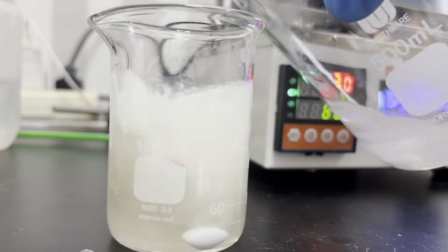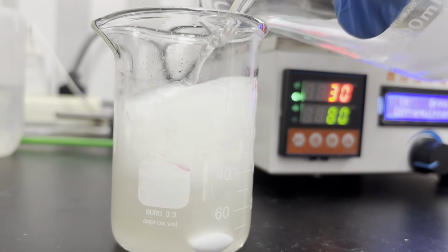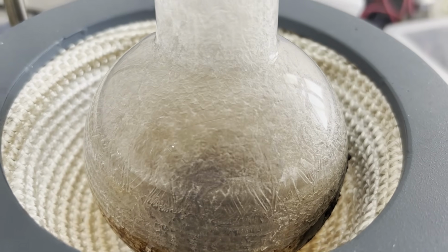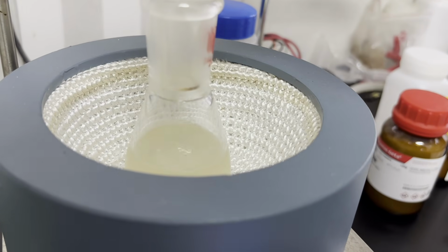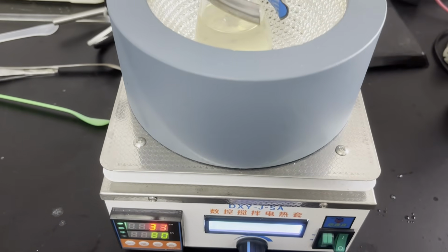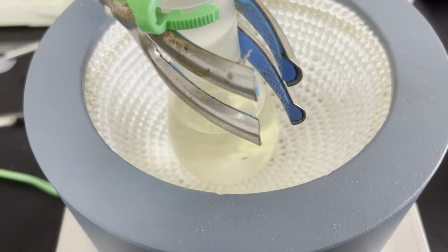I followed the workup from literature using sodium bicarbonate to quench the acids and extracting with DCM, and after distilling off the DCM, I'm left with some tarry stuff, probably just a mixture of the starting materials. On the second attempt, I chose a warm day in late spring and took note of the room temperature, which was 26 degrees C. The reagents were used in a half scale, or 0.025 moles, and everything else was done exactly the same as the prior attempt.